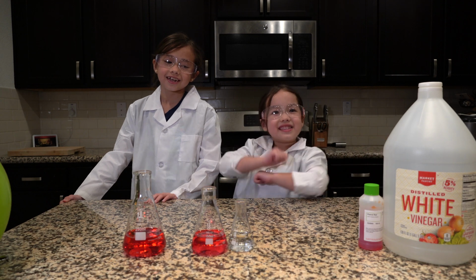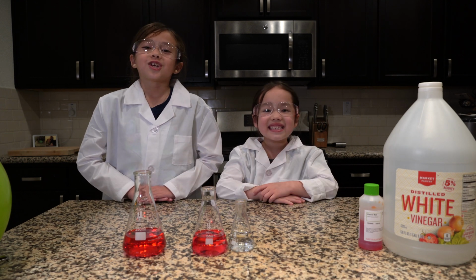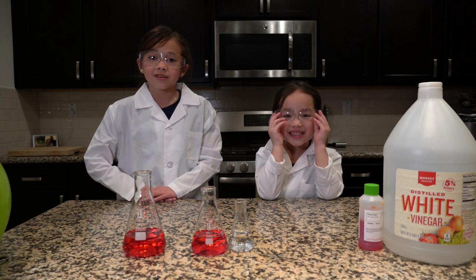Safety first. So Rhea, what experiment are we going to do today? We are going to do an experiment to show that carbon dioxide is acidic, and have an adult help you when you do this experiment.